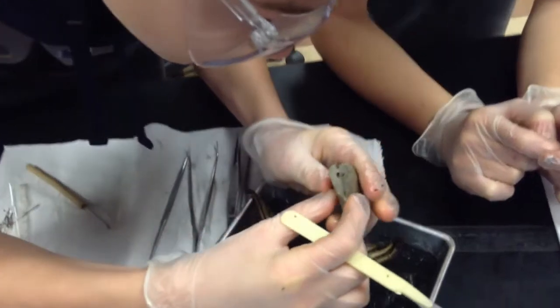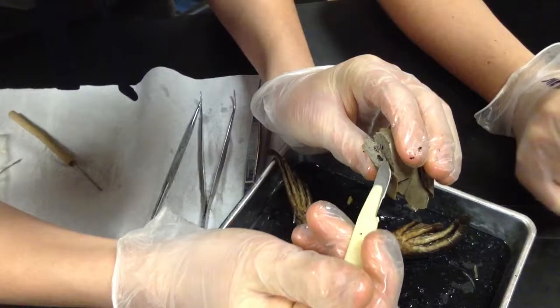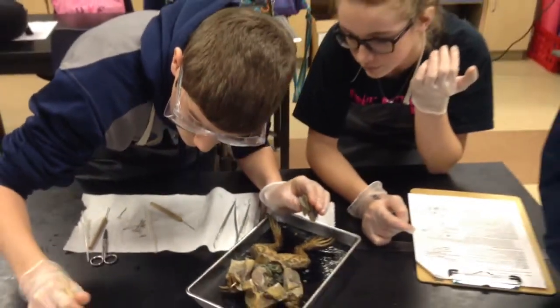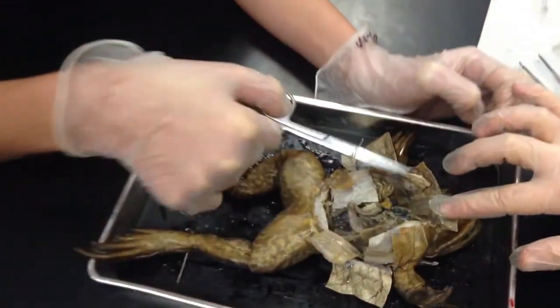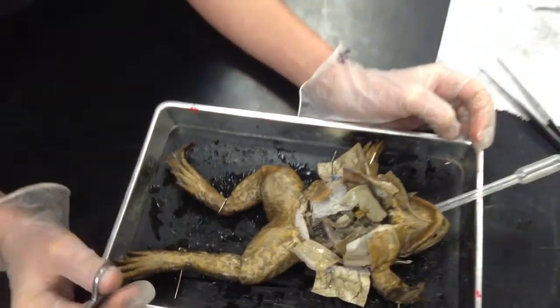That's what it looks like — the inside of the liver. That's probably a blood vessel because it's vascularized. Is this the gallbladder? Yes, that is the gallbladder. We took out something else — just took out some black seed looking thing. That would probably be the spleen.